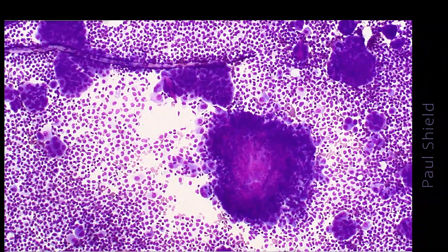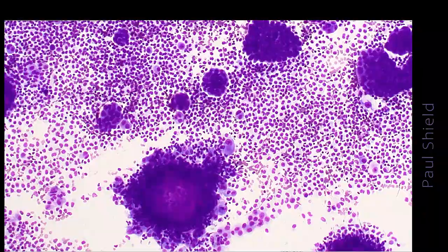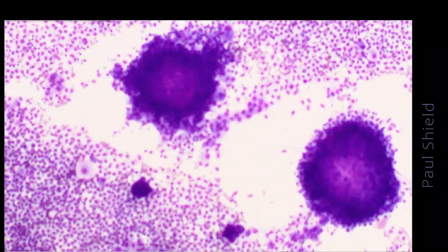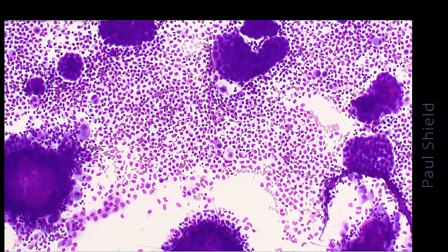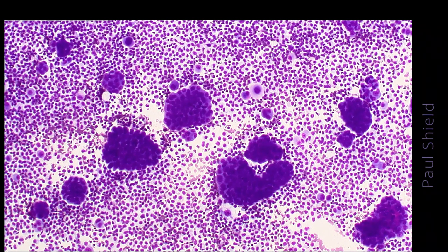And there's quite a lot of that in this specimen. So this is not always present, but it's quite a useful feature. It is seen very rarely in adenocarcinomas as well, but rarely to this degree, I think. So these are large groups. They must be malignant, and we really need to just check out the cellular detail to make sure they have mesothelial characteristics.